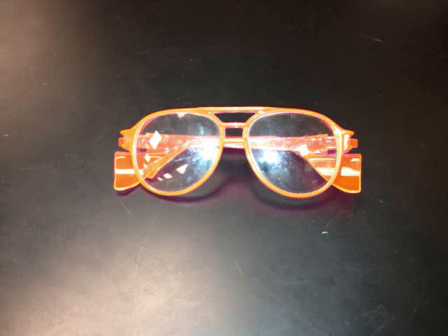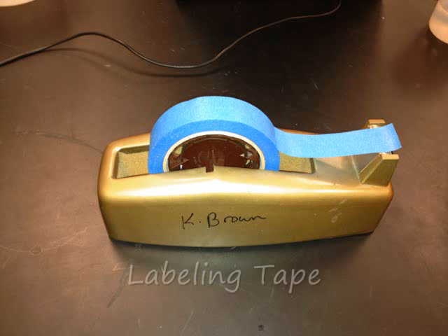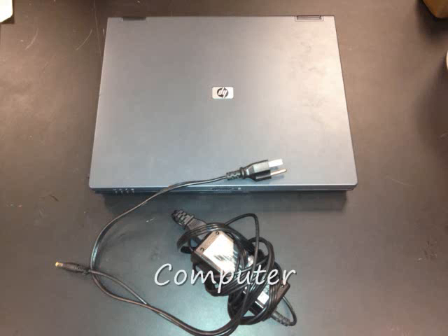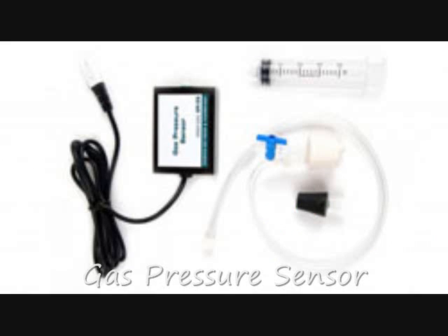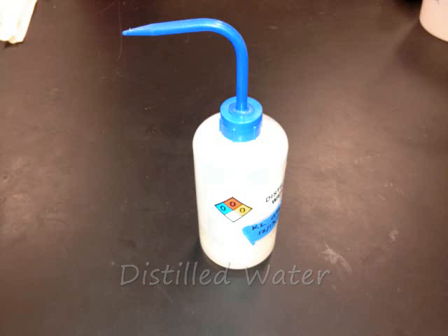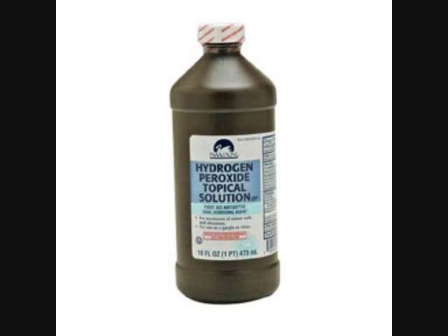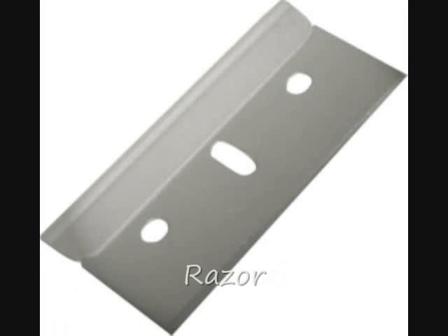Materials required: 1 milliliter pipette, safety goggles, pestle and mortar, labeling tape, test tube rack and test tube, computer, Logger Pro, gas pressure sensor, electronic scale and weigh boat, distilled water, graduated cylinder, beef liver, hydrogen peroxide, cutting board, tweezers, and a razor.